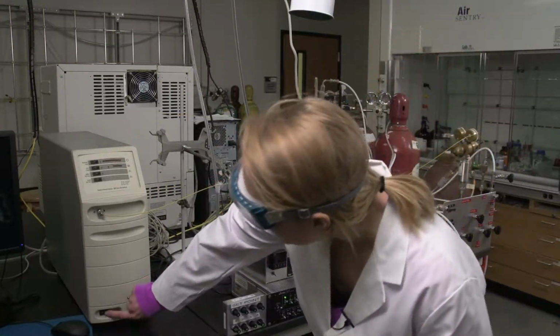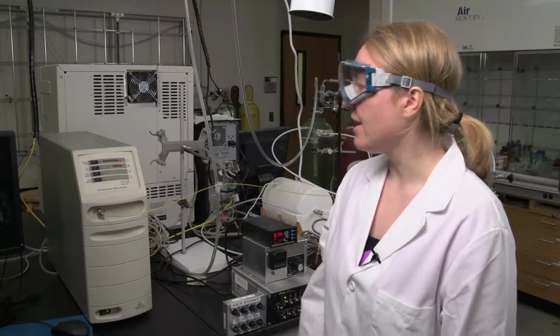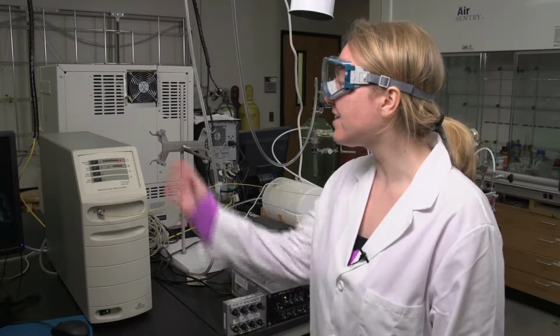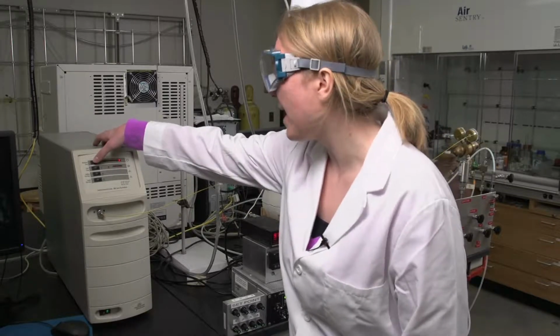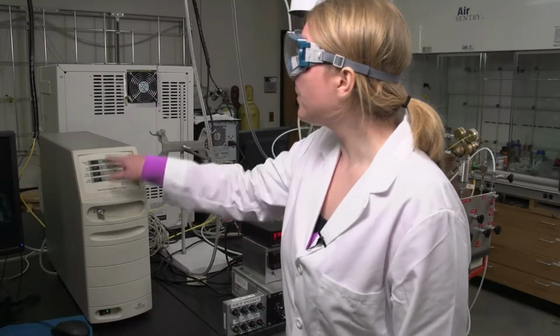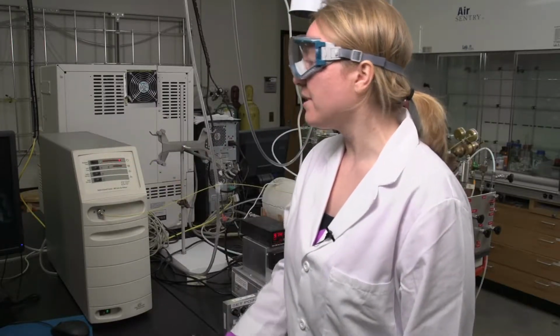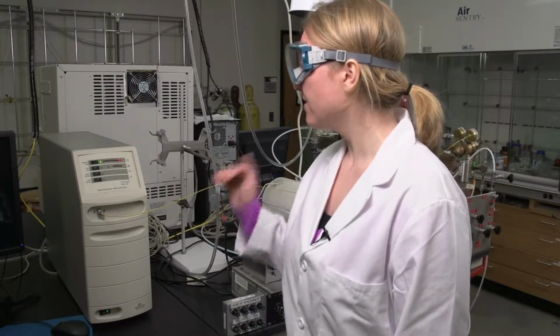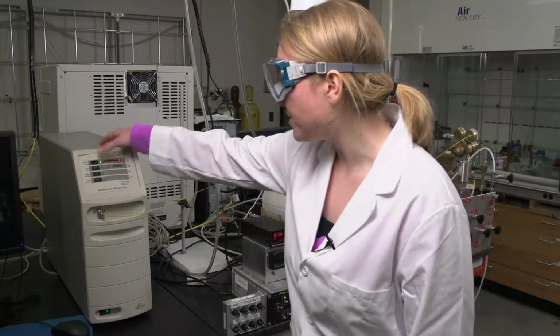So now you're going to want to turn on the mass spec. So flip the rocker switch at the bottom to turn it on. And then you can start by flipping the top toggle switch, the mechanical pump. Note that the light is green and it's solid. You'll want to make sure that the green light is solid and not flashing before you turn on the next flip. So now this is not blinking, we can turn on the turbo pump.